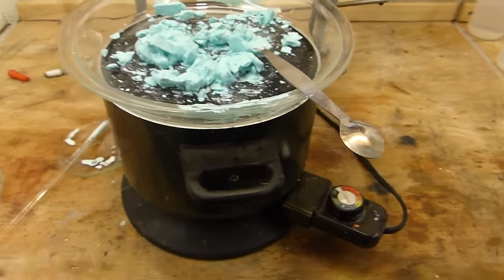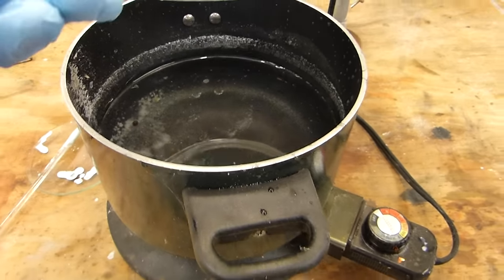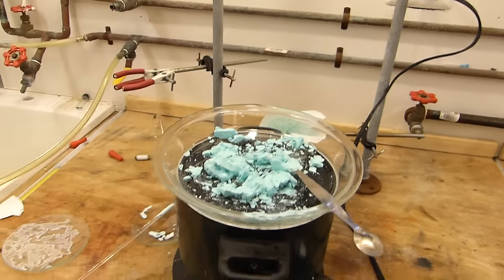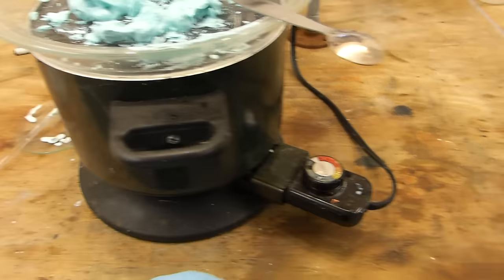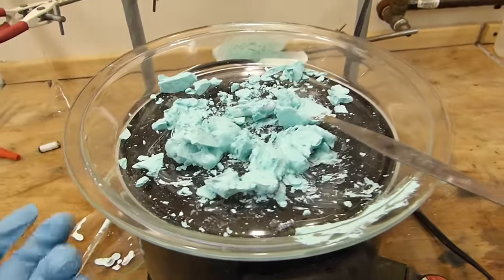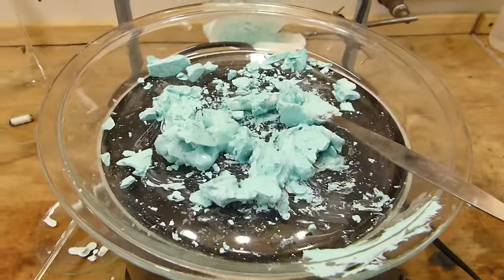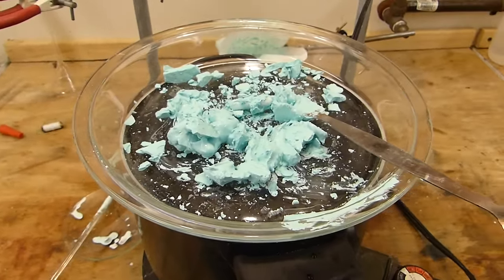A good way to dry things like this is to use a steam bath. You can see here I've got a pot, it's an electric kettle, kind of dirty. It's got some water in it and the pan that gets placed on top. The steam can't reach this stuff and you just turn it on and let it simmer. As the water simmers of course this gets warm and it's a Pyrex dish so it's not going to crack and it'll accelerate the drying of this stuff by a lot. So I'm going to go ahead and do that to speed this up so this doesn't turn into a three-day video.